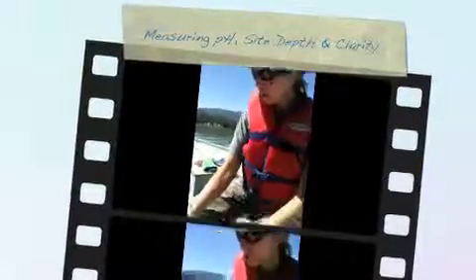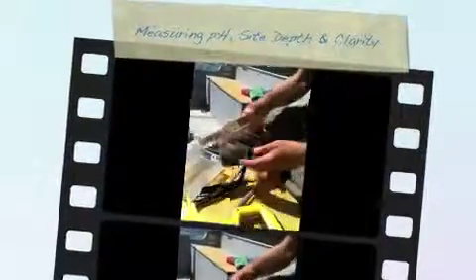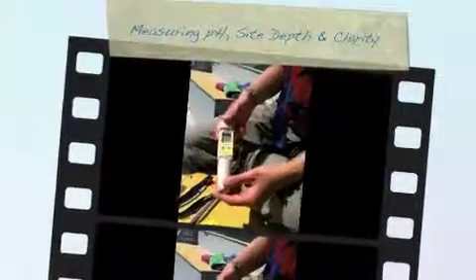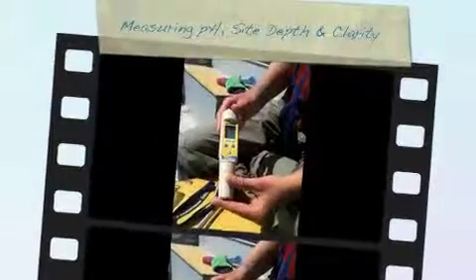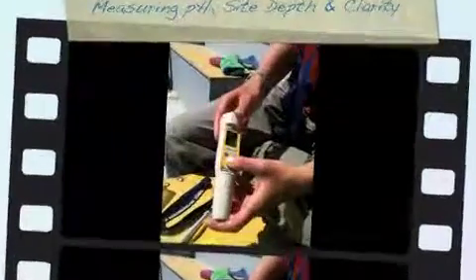We also take pH, which measures how acidic or basic the water is. With a simple meter, we just stick it in the water, press the button, and it gives us a reading.